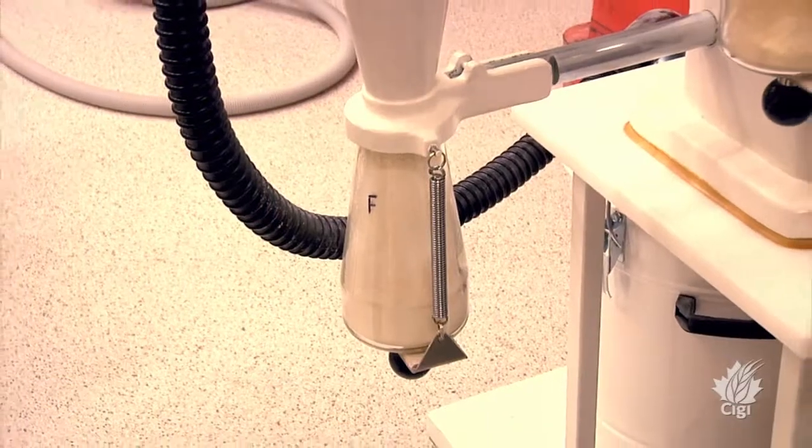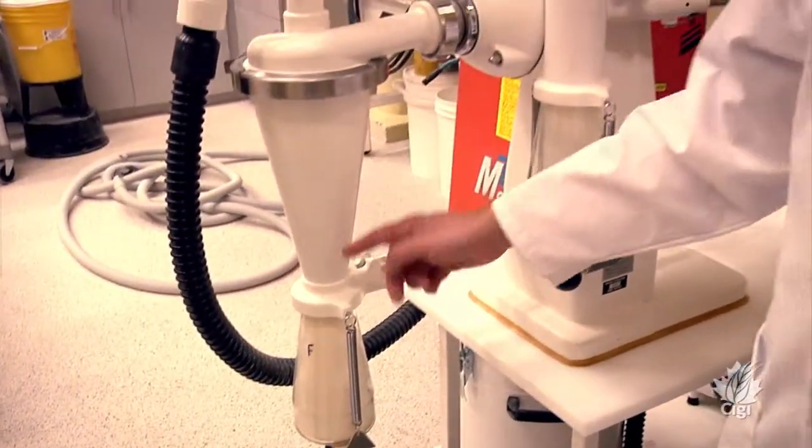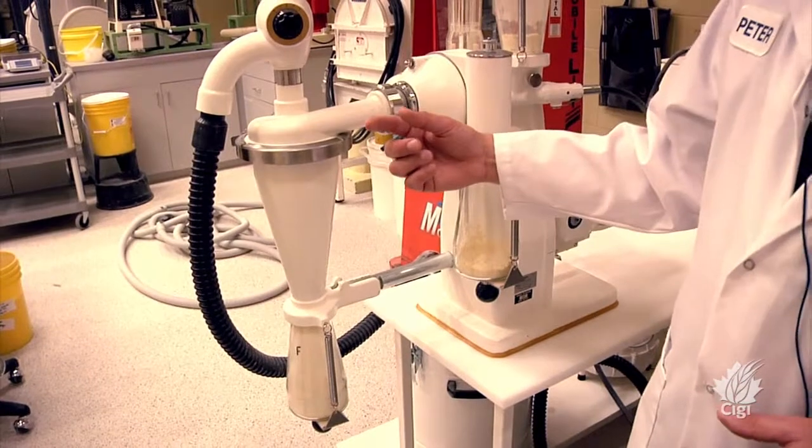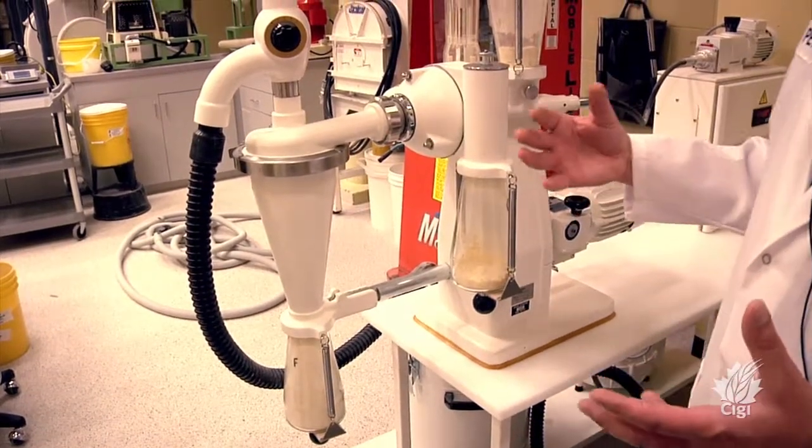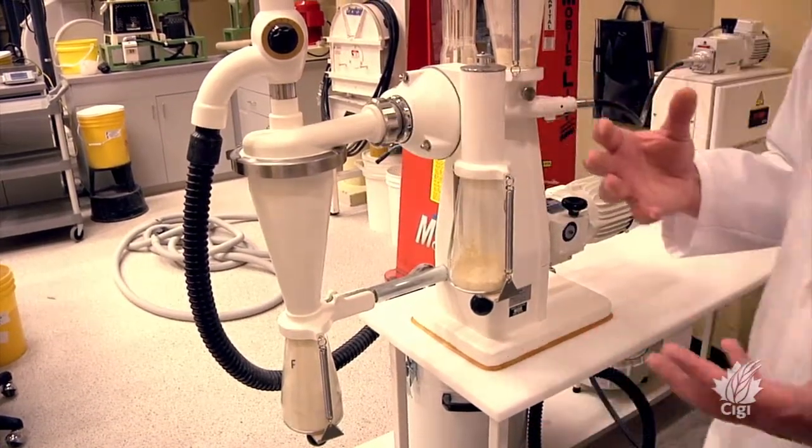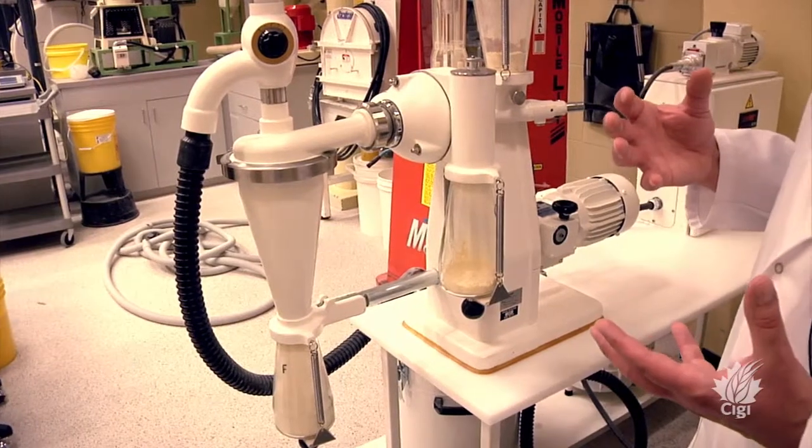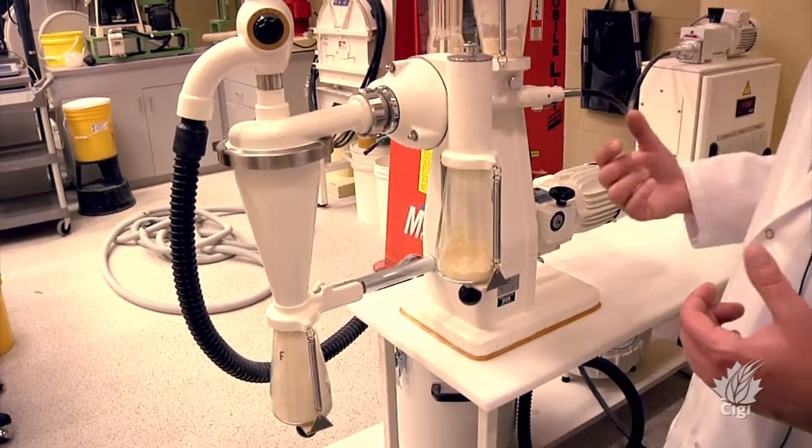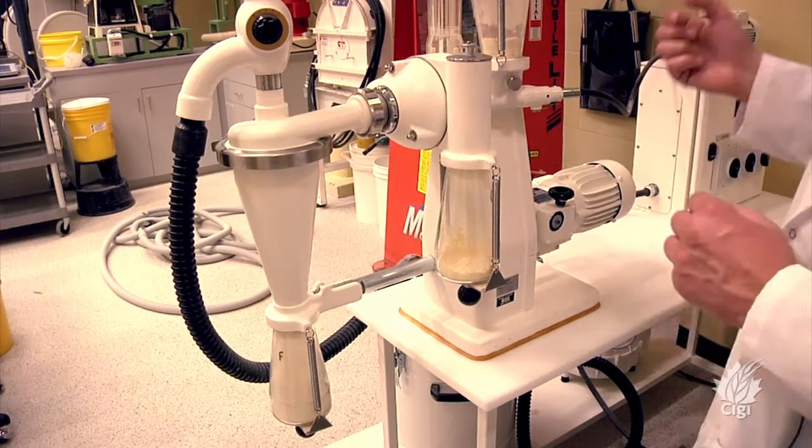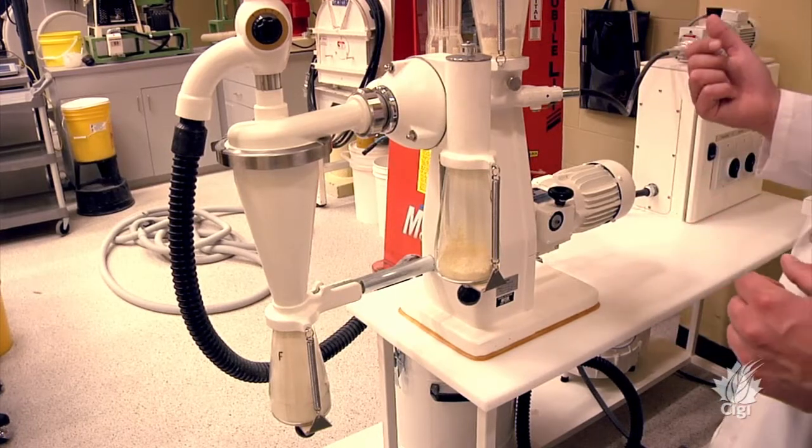Once the product is finished running through, what I want to do is see how efficient the process was. Ideally, I would like to have a really concentrated protein fraction, and that to me will mean that the process was efficient and the settings were set correctly for that particular flour.